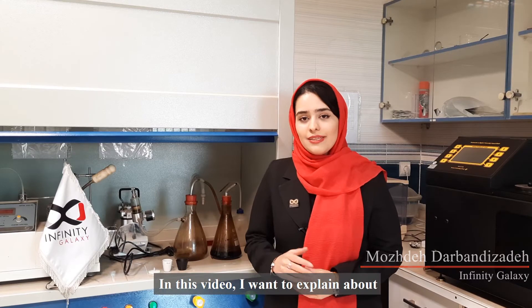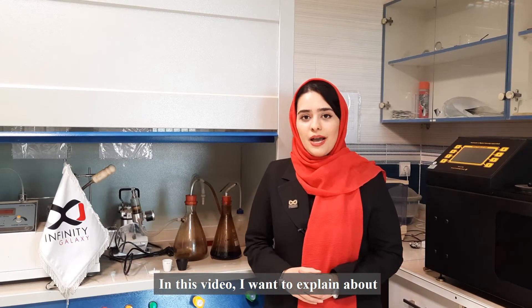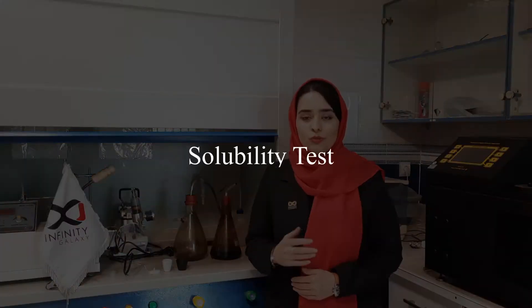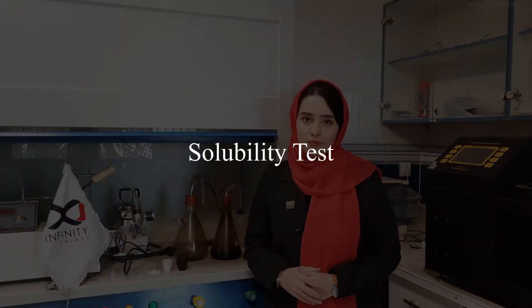Hello everyone, I'm Mojdeh from Infinity Galaxy. In this video, I want to explain about the solubility test of bitumen.